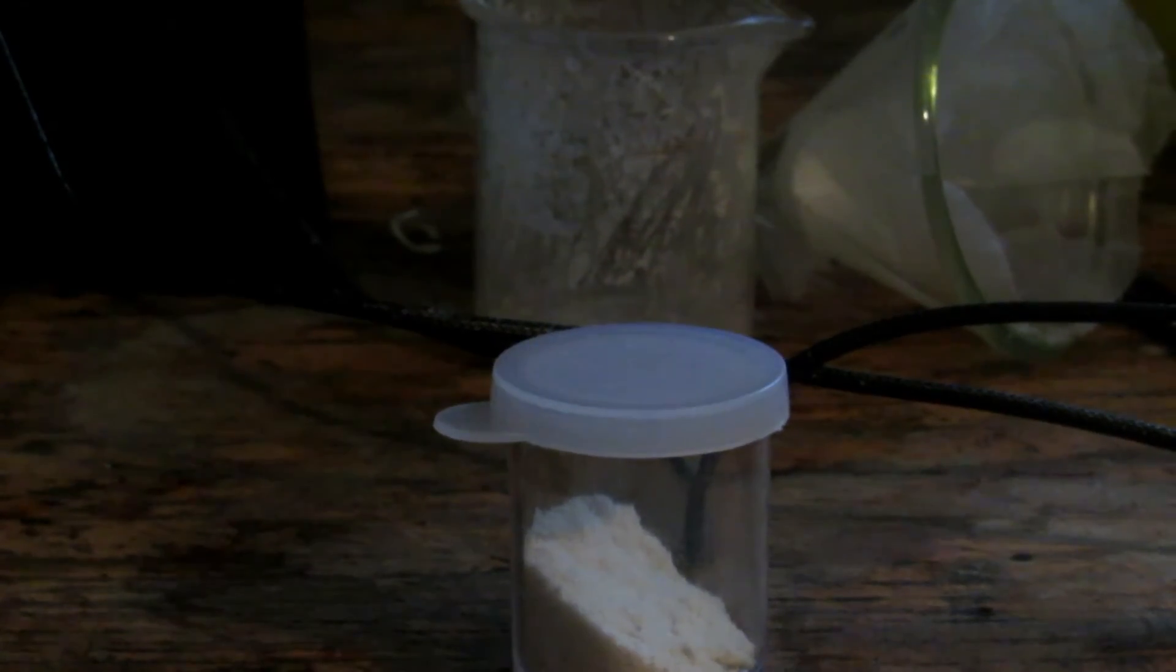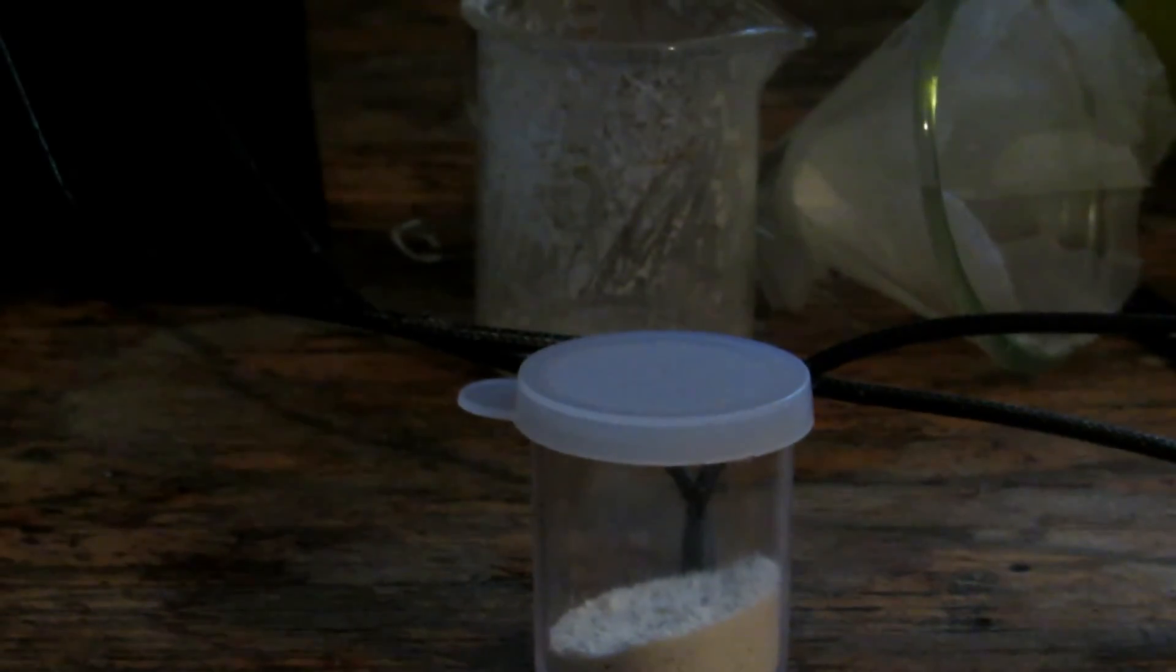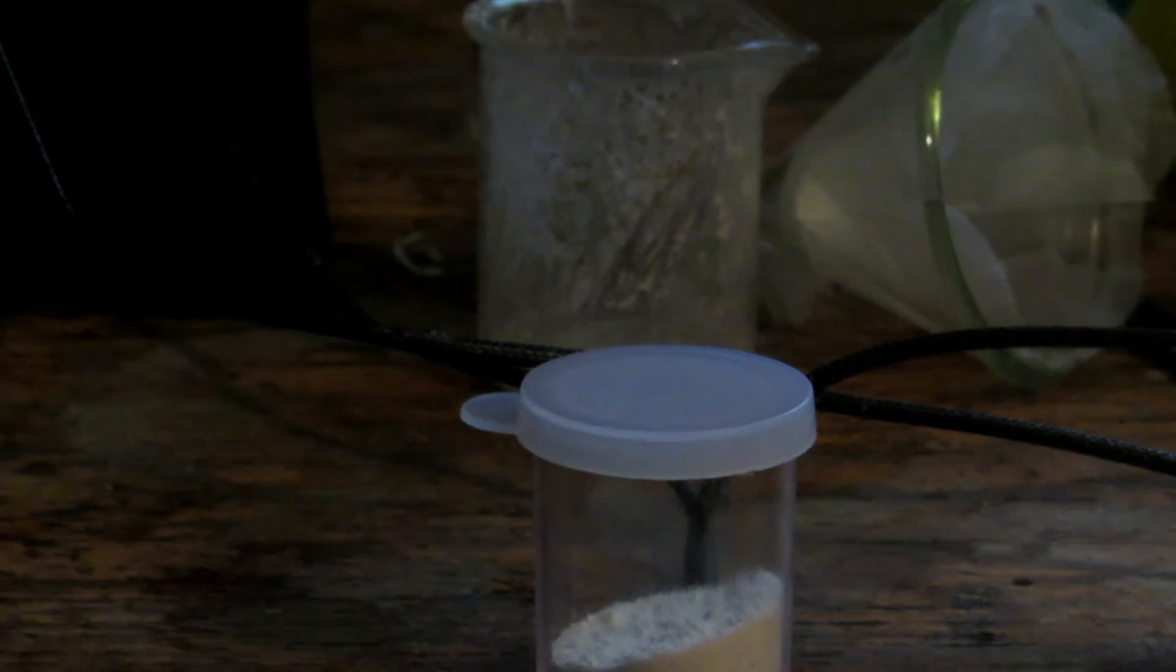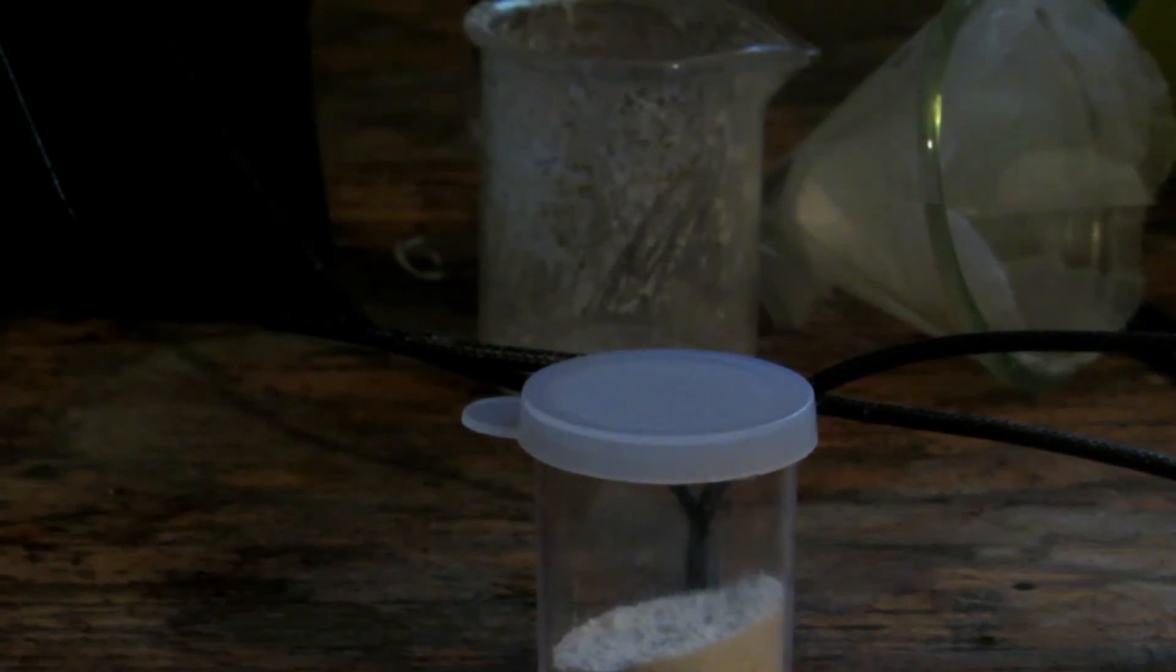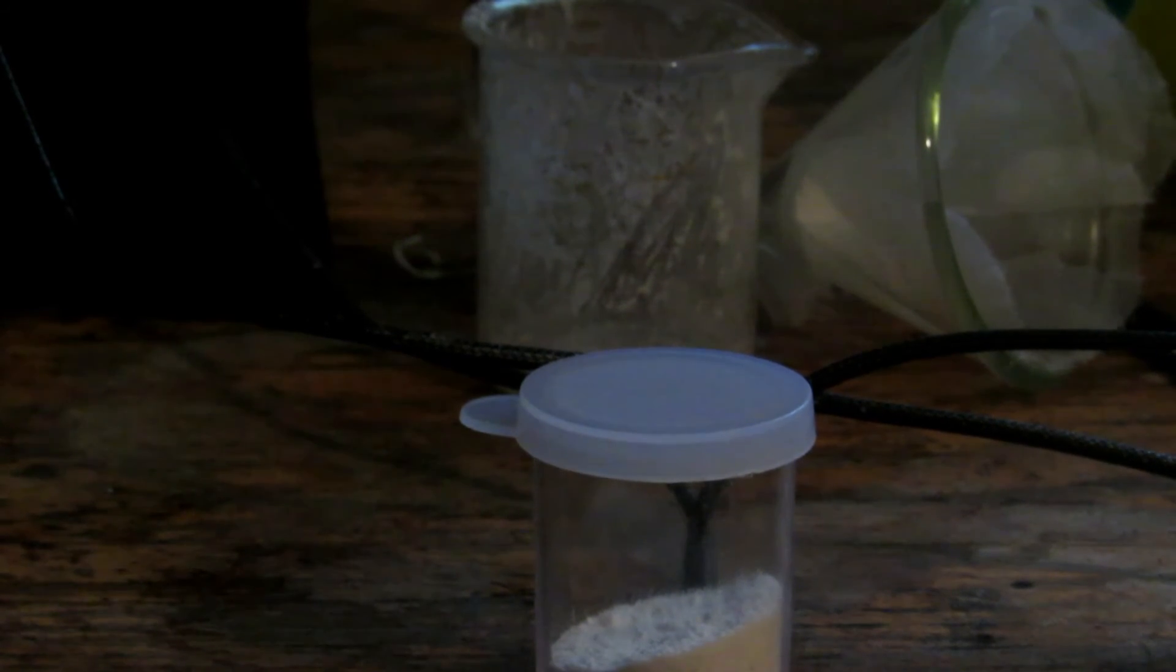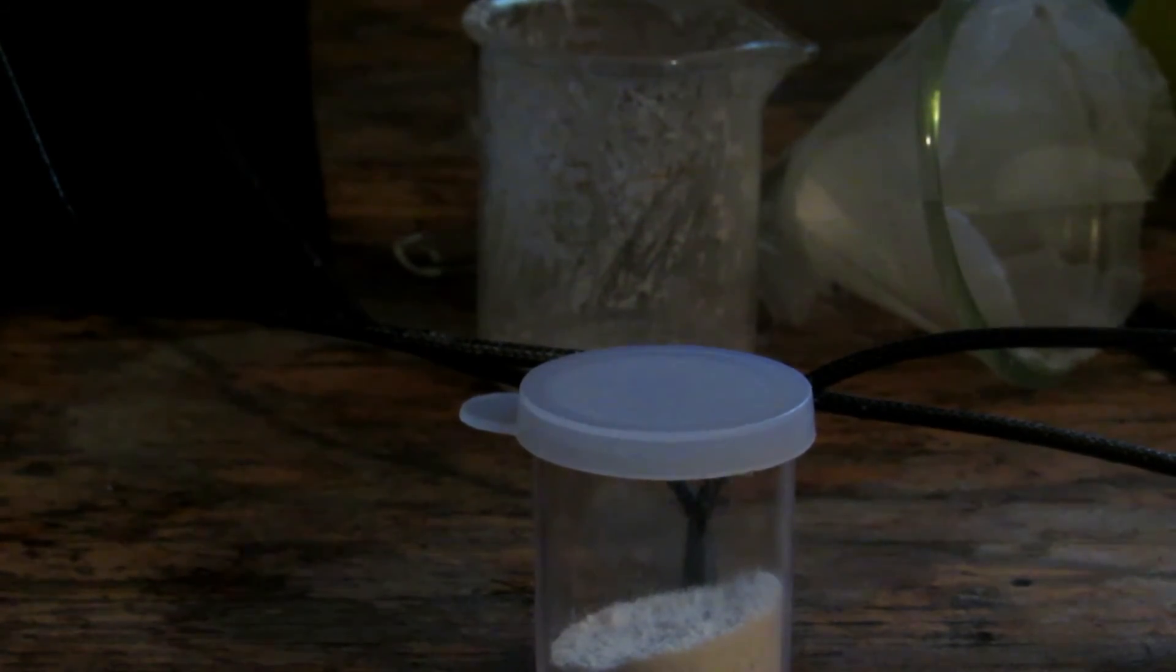After weighing that out, we have just over 4 grams of potassium iodide here. That's plenty for several different reactions. It's a wonderful catalyst for the decomposition of hydrogen peroxide. I'll probably end up using a good portion to do the golden rain experiment with lead nitrate.